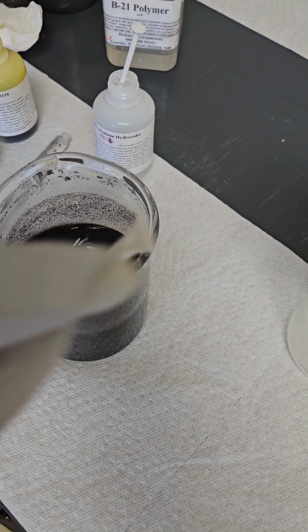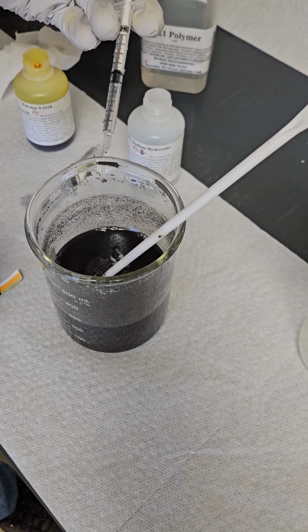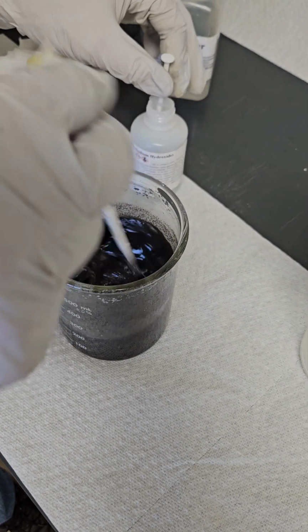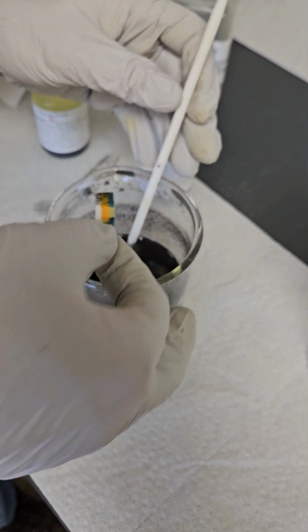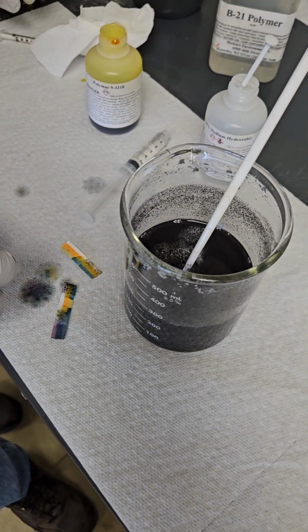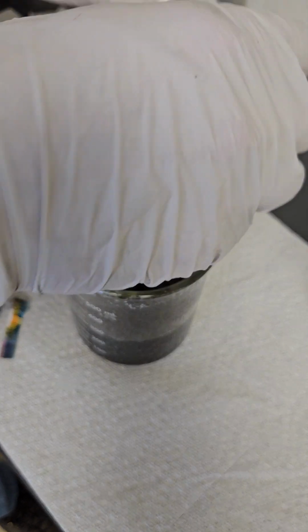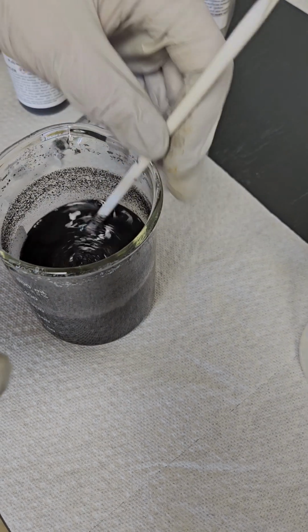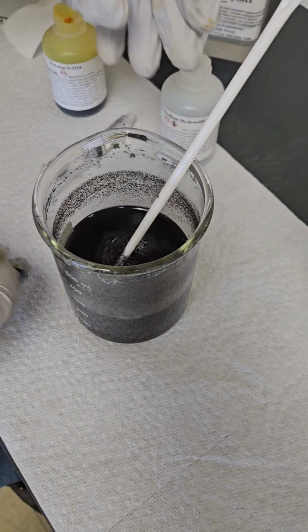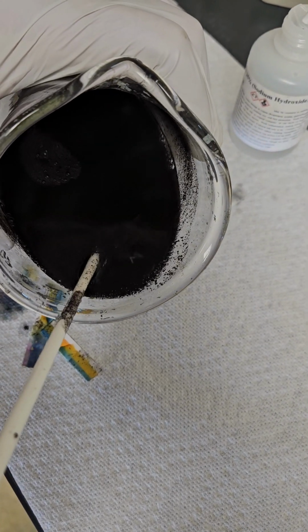So just a touch of caustic should bring it back up. Let's get a few drops of caustic maybe, and bring it back up a little bit higher, to like neutral, like a 7. 3 more drops. All right, now I've got it back up toward a 7, and I've got a clean break there.